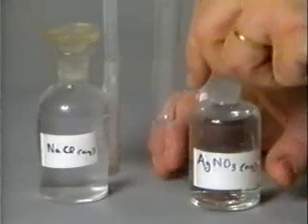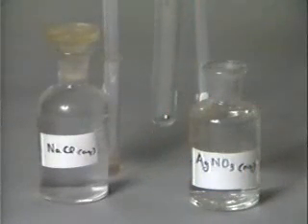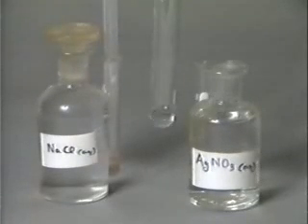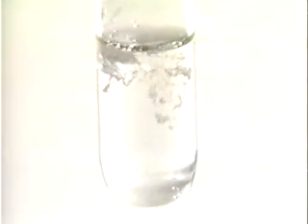The first precipitate will be produced from aqueous silver nitrate and aqueous sodium chloride. Aqueous sodium chloride is added to the silver nitrate solution. We observe a white precipitate of silver chloride.